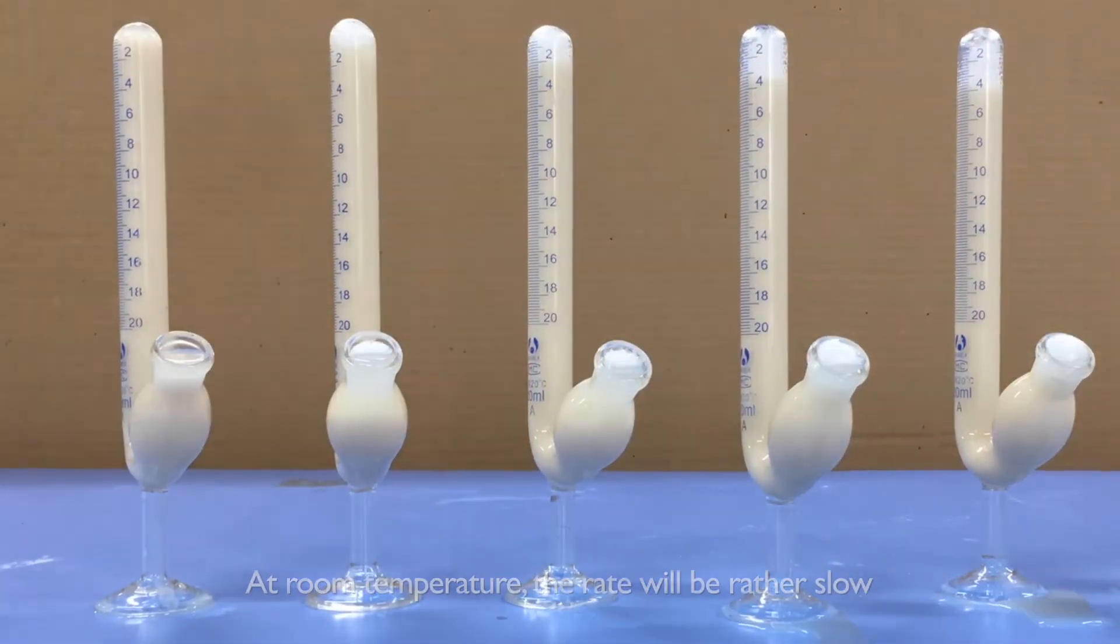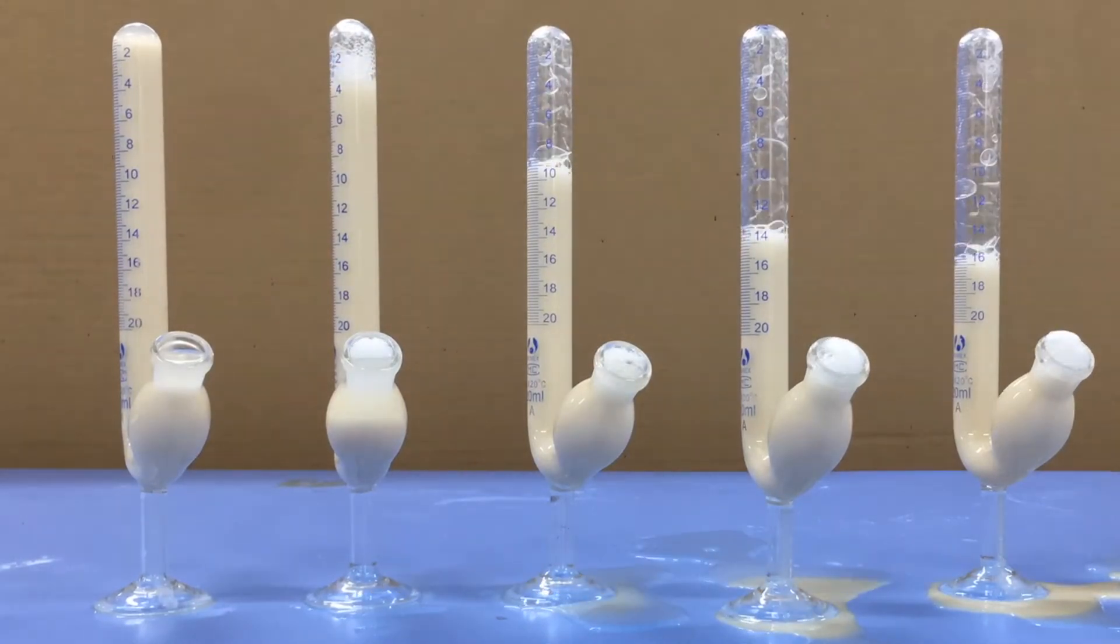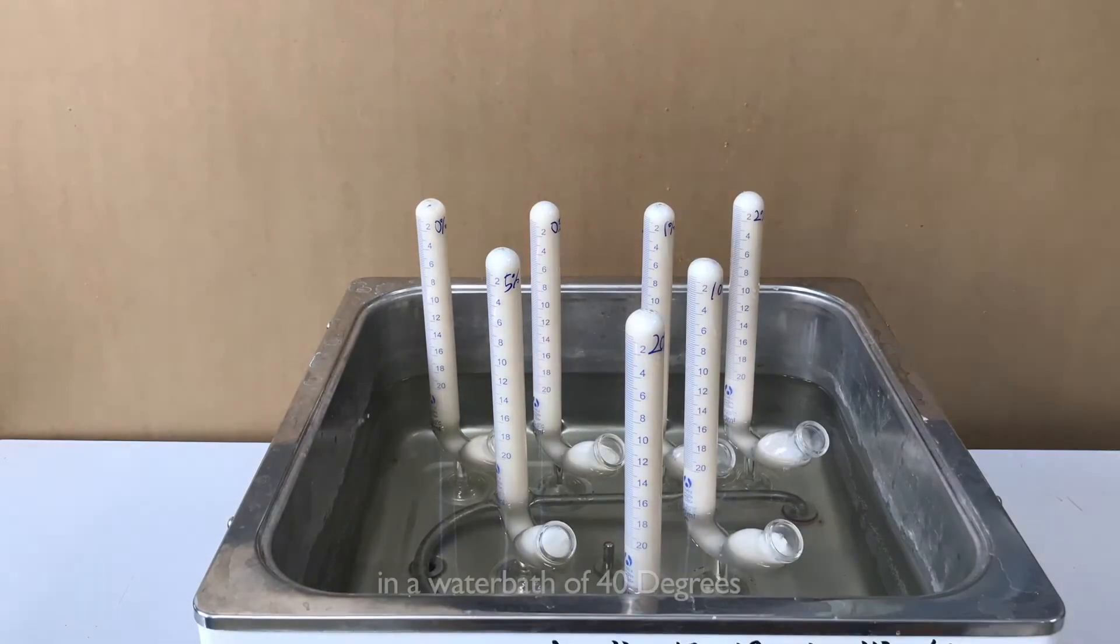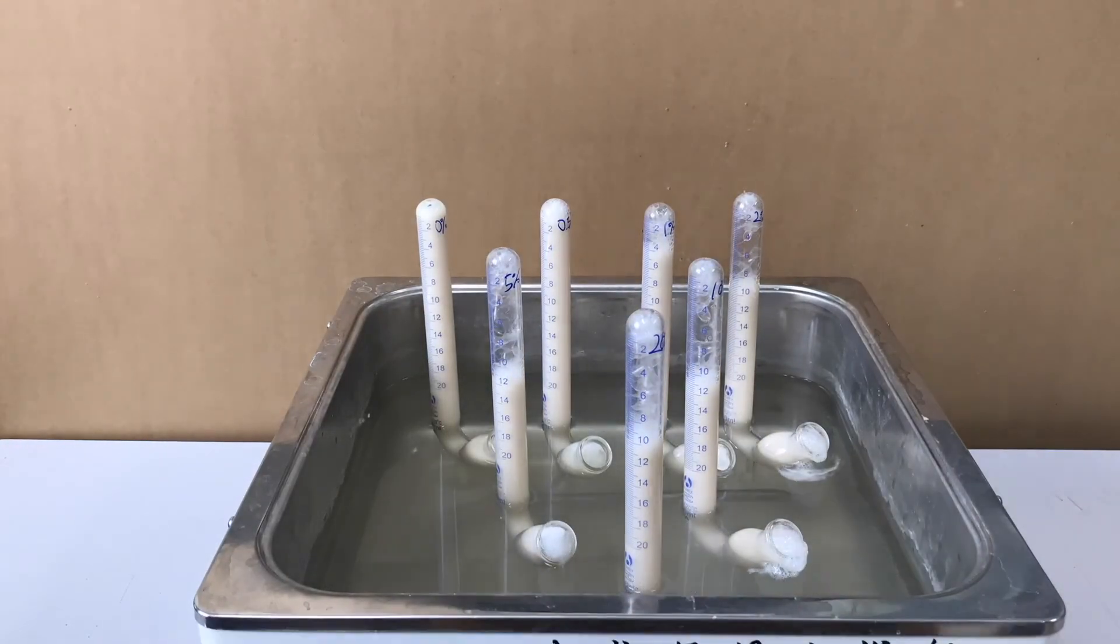At room temperature, the rate will be slow, so every 5 minutes is acceptable. It is recommended you try doing this in a water bath of 40 degrees to speed up the reaction.